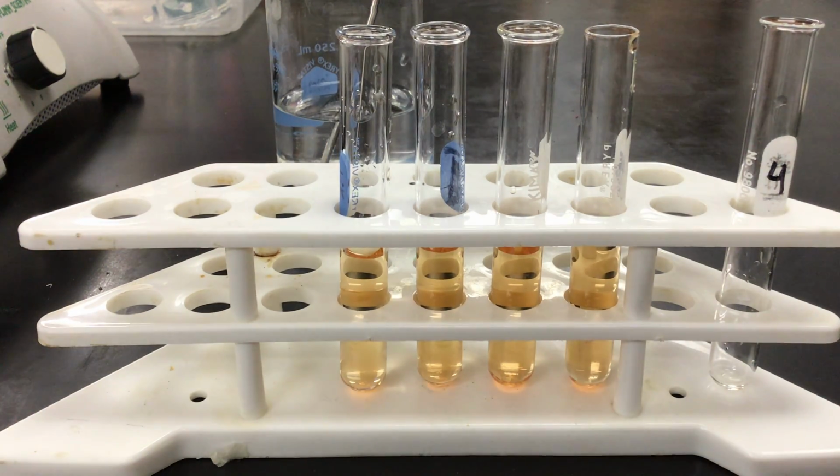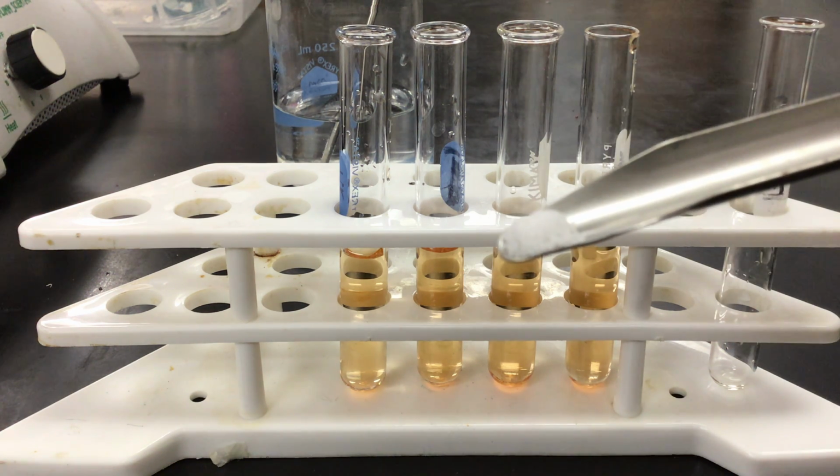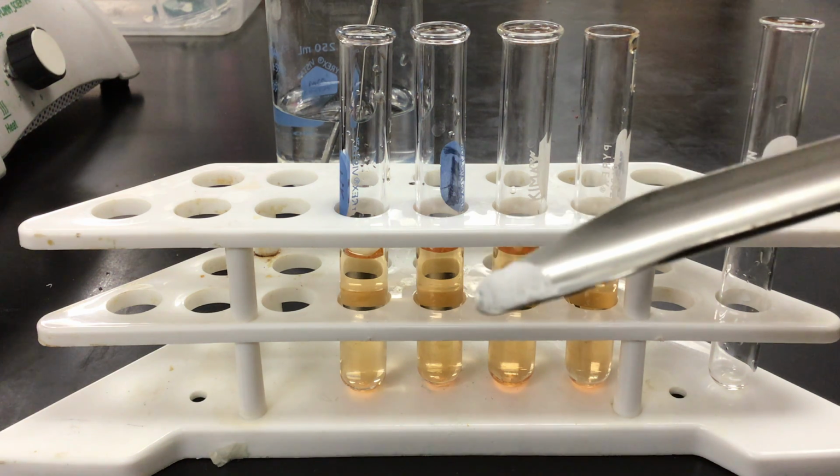the experiment. We're going to cross-reference back to that one to see as I stress these other 3 systems. In part 3, we have 3 stresses, and we're going to see what happens as we do these different stresses and compare it back to the original. In stress number 1, I'm going to add some solid potassium thiocyanate. And solid potassium thiocyanate is this white compound.